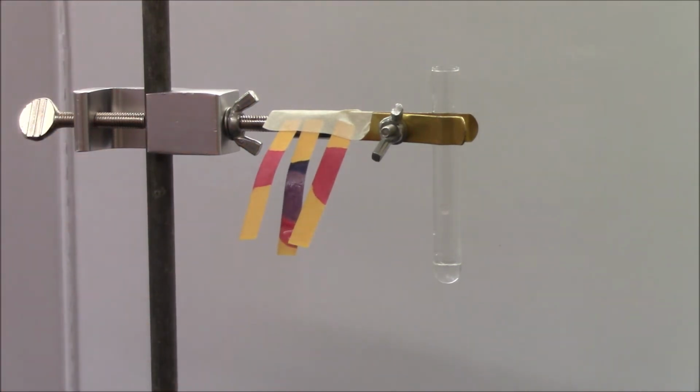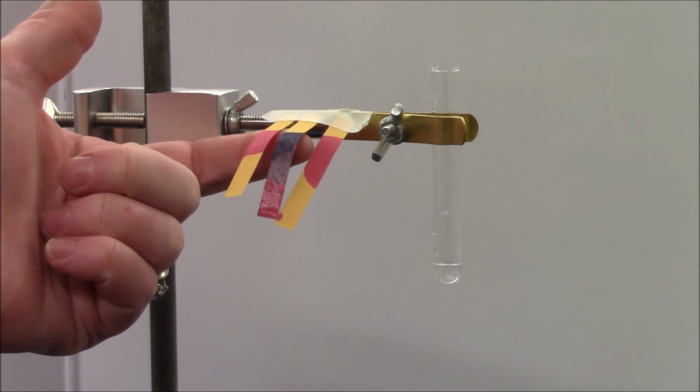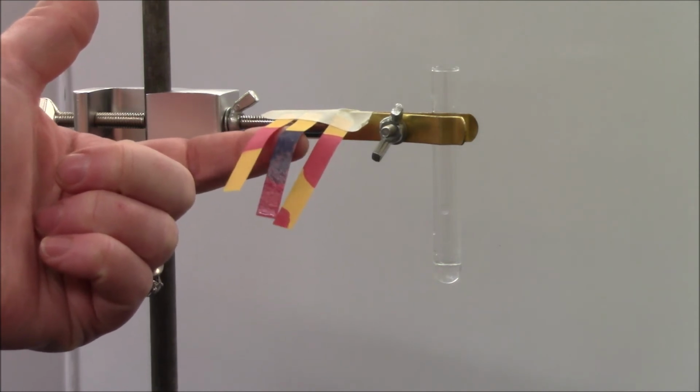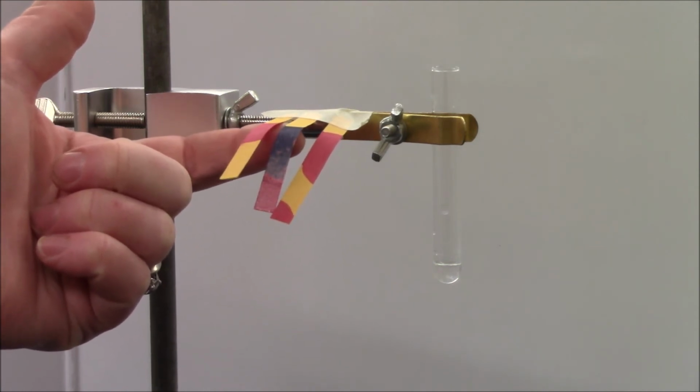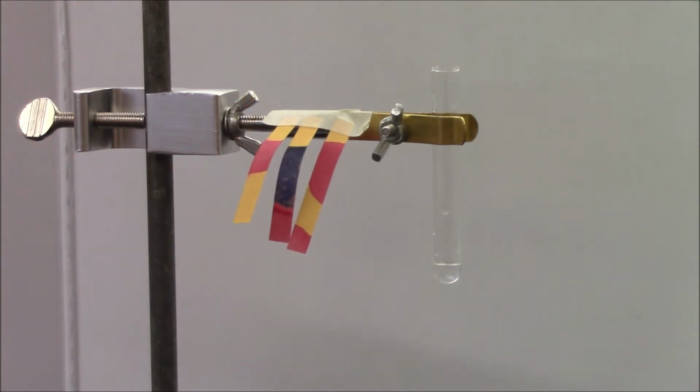Okay. Note that when I added the acid on top of the base, you can see that the color has changed. It's because the acid and the base are reacting with each other to form something that is neutral. And eventually, when that reaction happens, the paper will change color, and it'll be more of its original color, maybe a little green, than it was before.